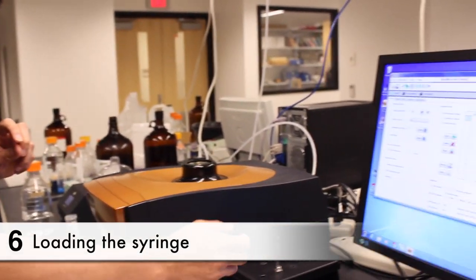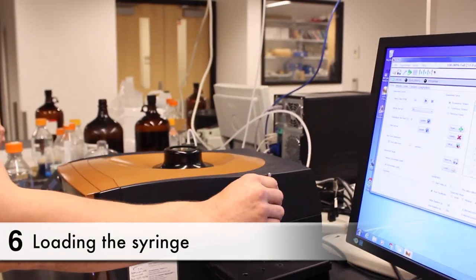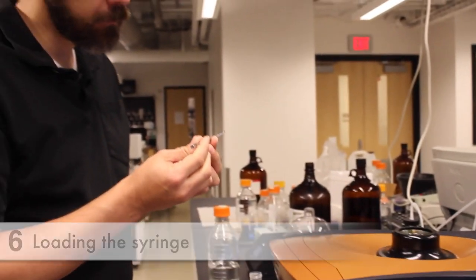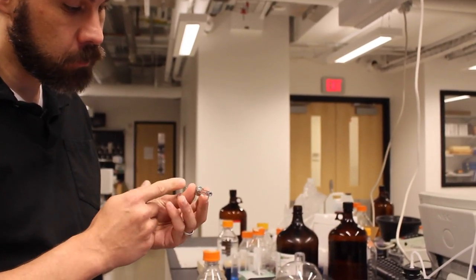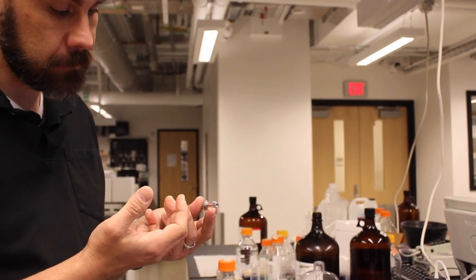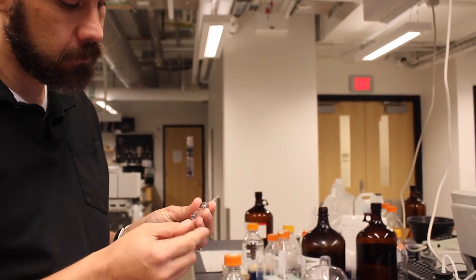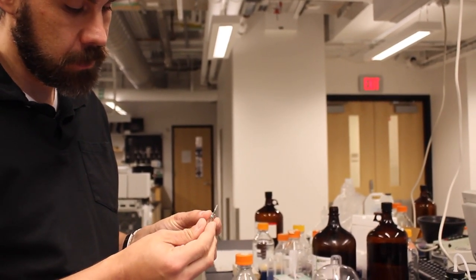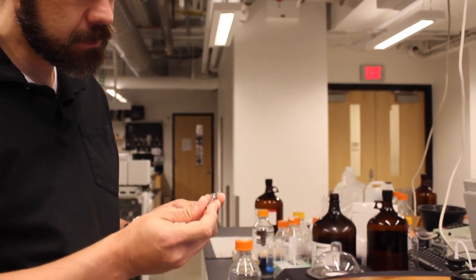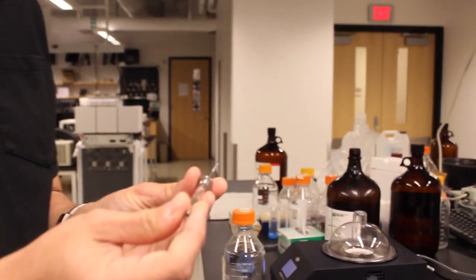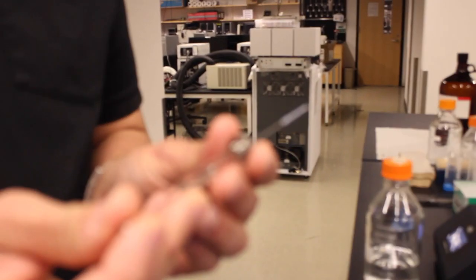Now we need to fill the syringe. And as I mentioned before, normally the syringe would be filled with buffer that contains your ligand. The syringe holds 50 microliters of liquid and this is perhaps the most tricky part of the whole procedure in setting up the instrument.